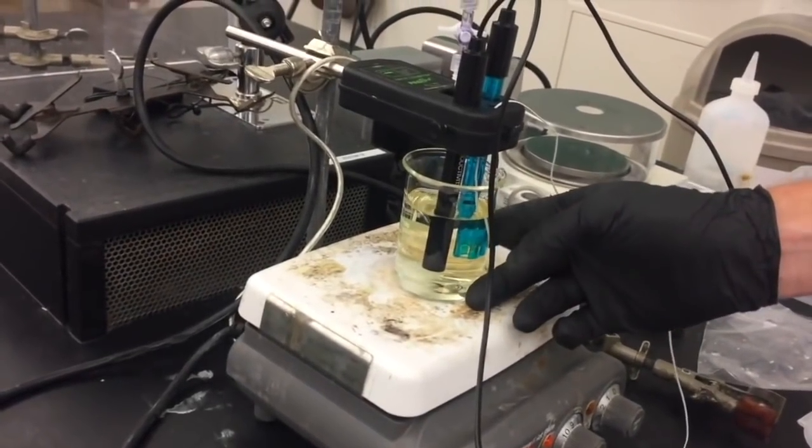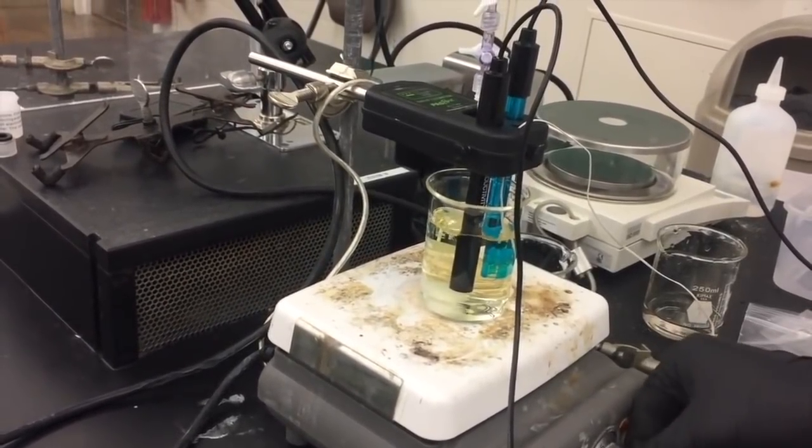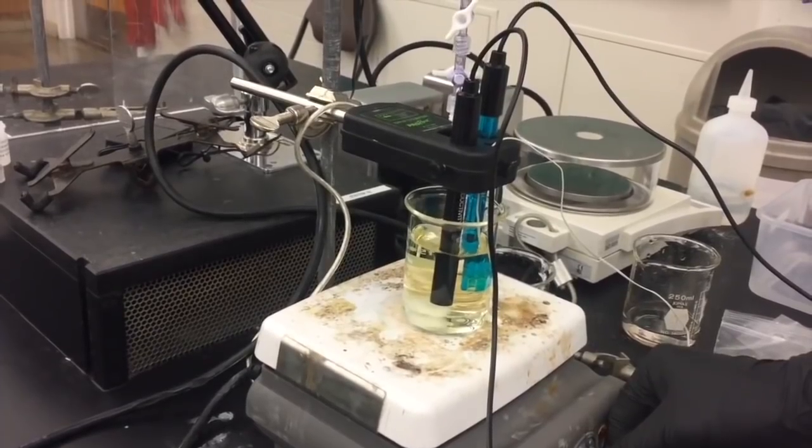Once all of the probes are in place turn on the stir plate and double check that the stir bar can spin freely without hitting any of the sensors. If necessary adjust the sensors to be higher.